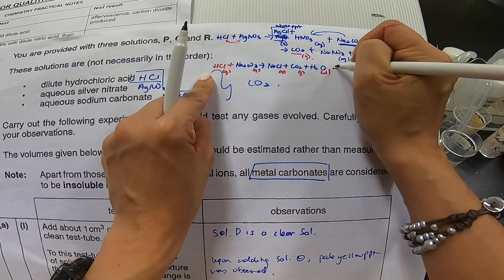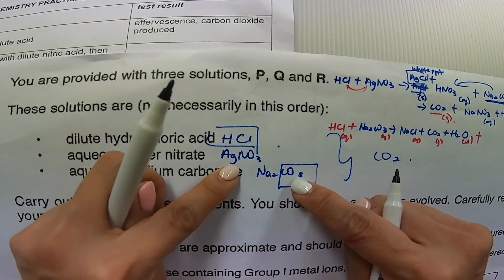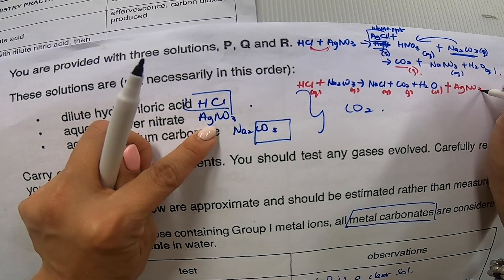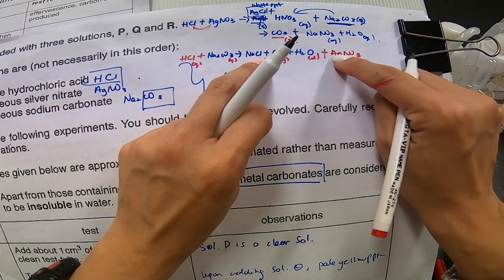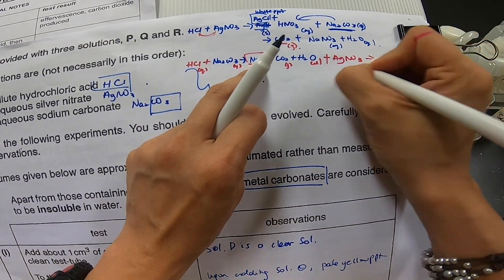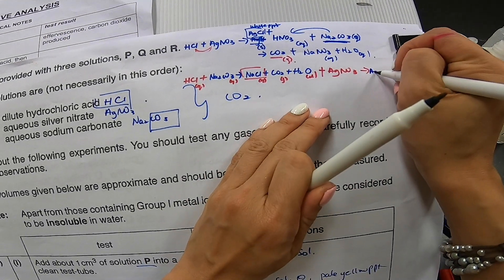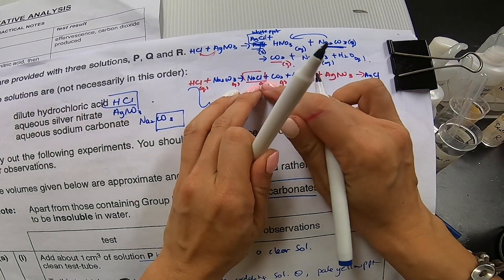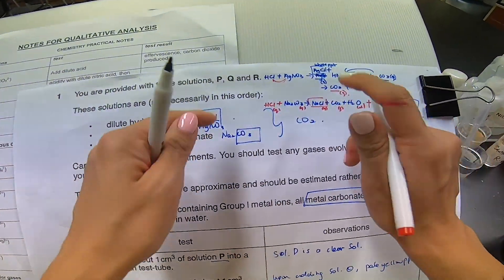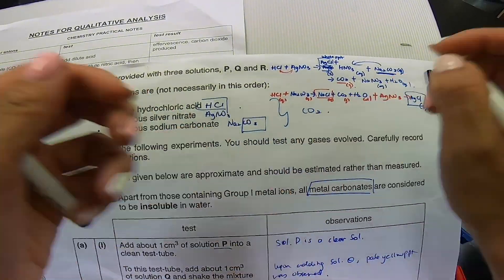So, and then, you add what? So, I have added this with this one here. The next one will be my silver nitrate. So, I add silver nitrate. Voila. Silver nitrate actually will react with this one, which is my sodium chloride to give a white precipitate. So, I will have AgCl. Let me write down AgCl over here. And, this is my white PPT solid state. I will stop there. So, I have added this permutation already. What permutation have I not added?